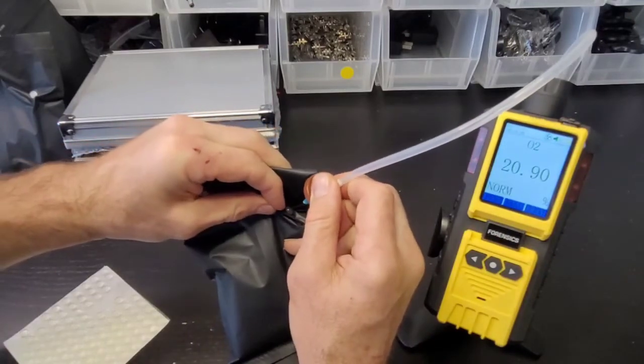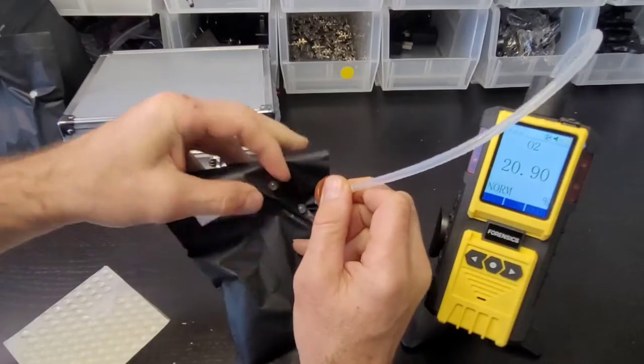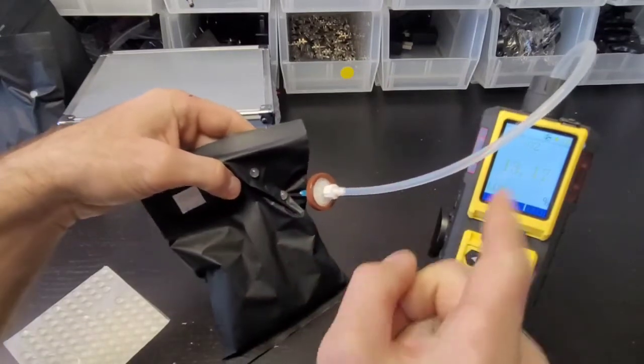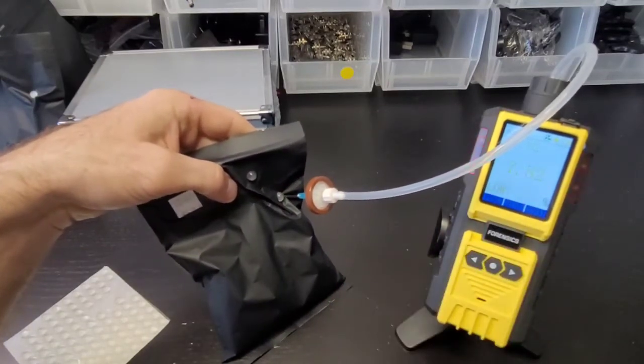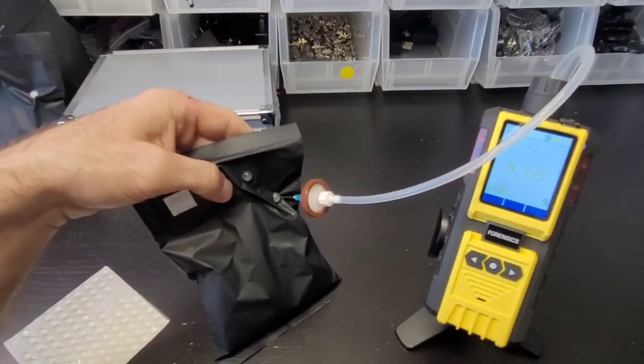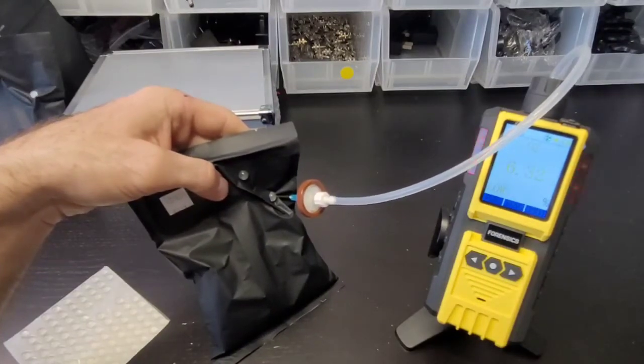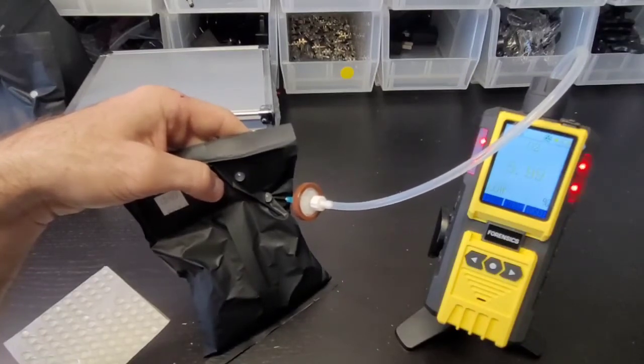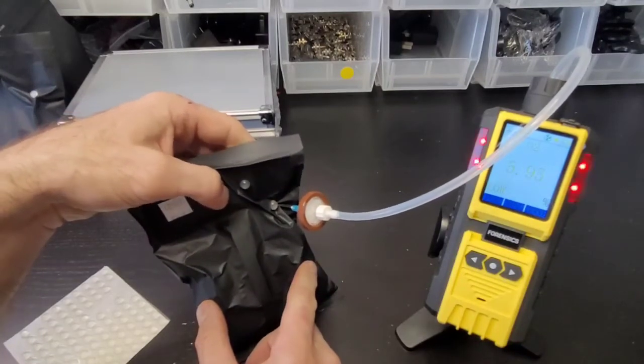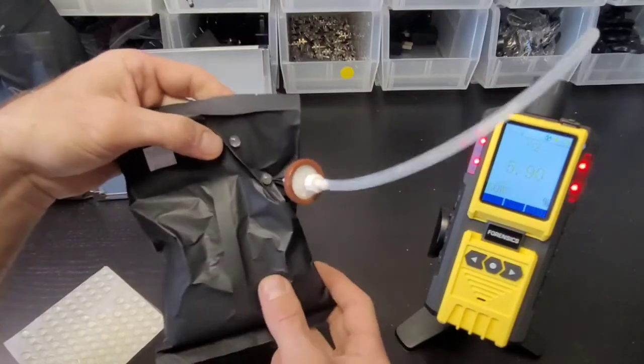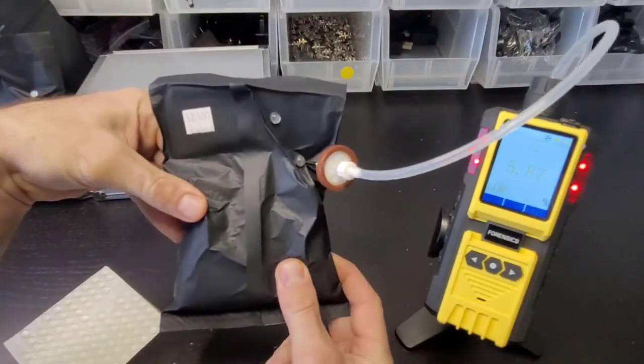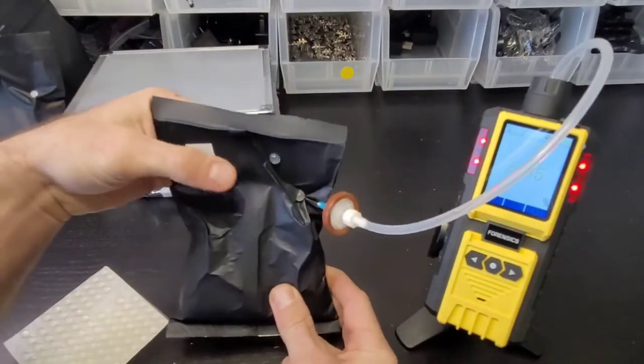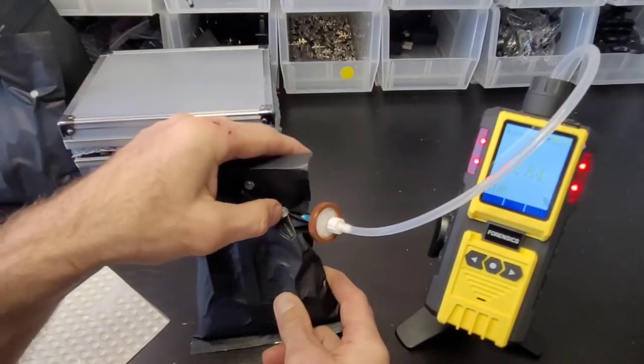You know when you're in when it actually does change oxygen levels - 6.5, 6.3. I think this is the lowest we have, it's going to go into the fives. That's pretty good. Again, limited headspace but we're still getting confirmation of a flush. 5.8%.